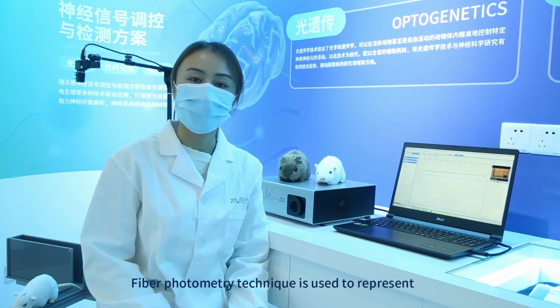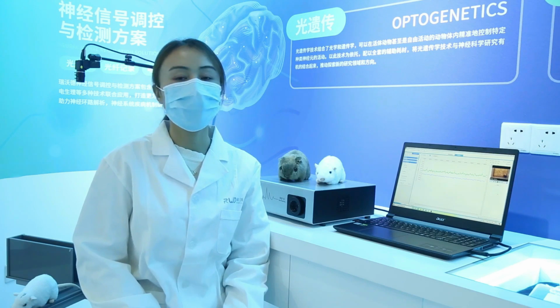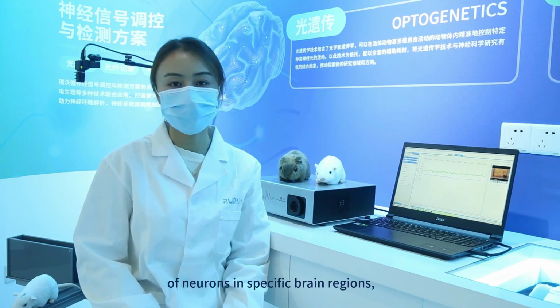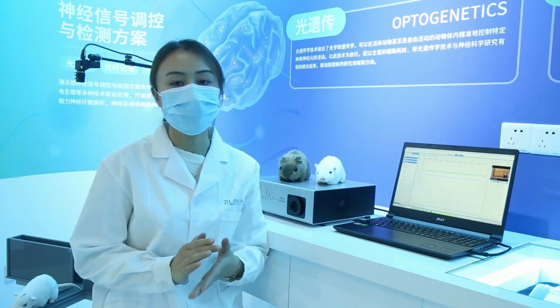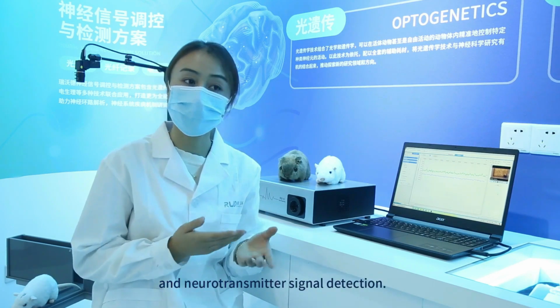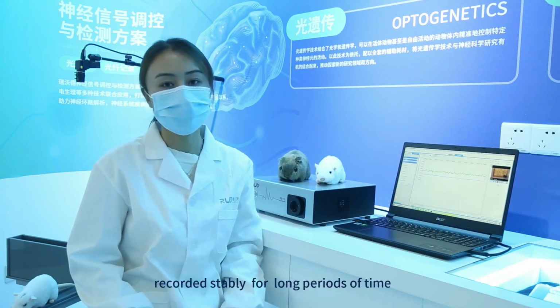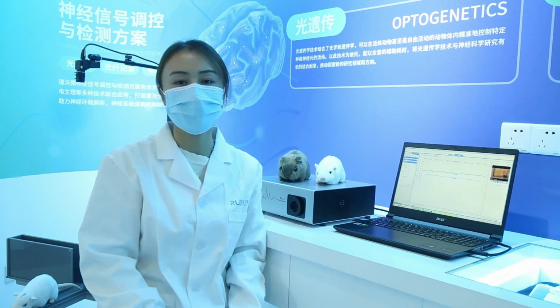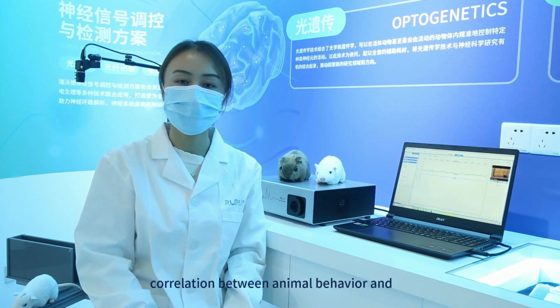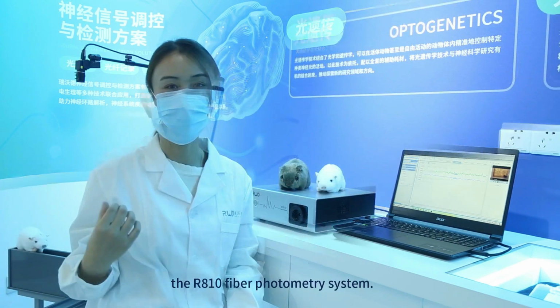Photometry is a technique used to represent population neuronal activity by recording fluorescence changes of neurons in specific brain regions, and is commonly used for calcium signal recording and neurotransmitter signal detection. Photometry can be recorded stably for long periods of time, so it is well suited for studying the correlation between animal behavior and neuronal activity.